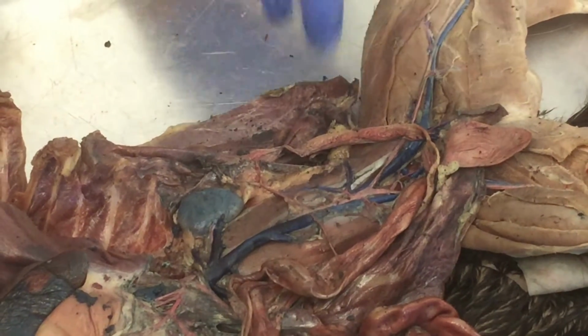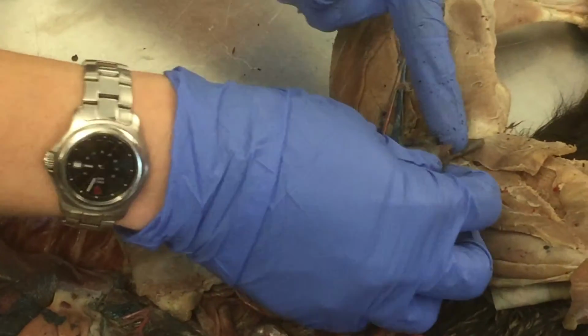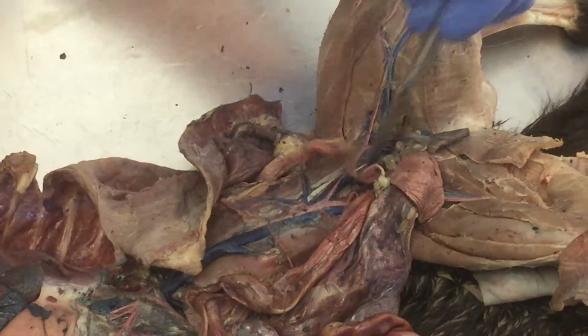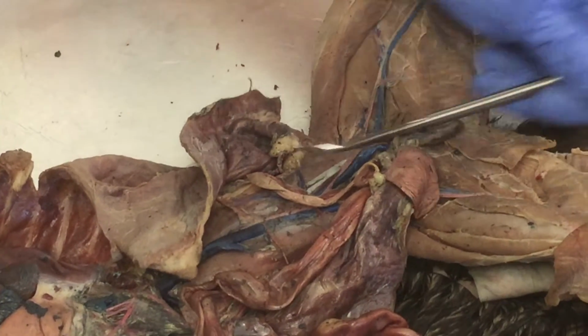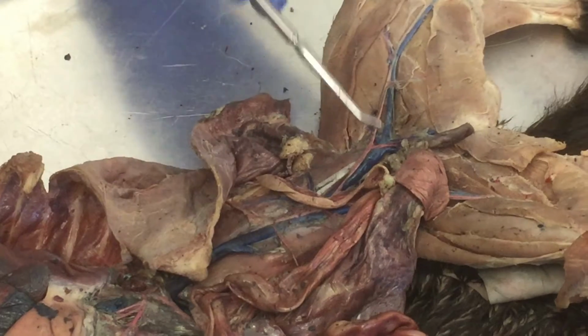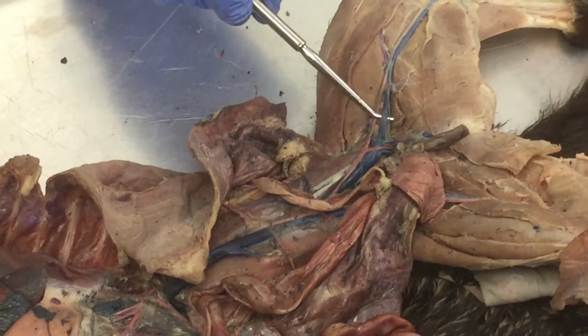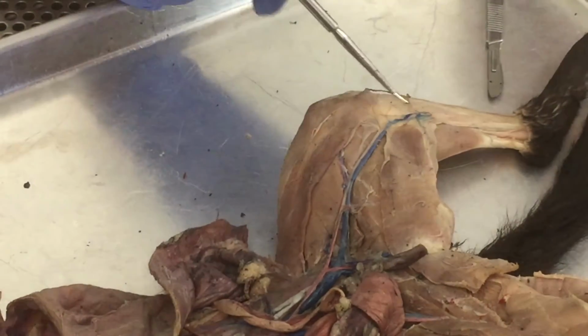So that's external. You're going to have your belly here that's still a bit attached, so you're going to have to skin it off of the inside of the leg. Okay, and that exposes, this would be abdominal wall region right here. So external beyond the abdominal wall becomes what? Femoral, and then around the kneecap, saphenous.